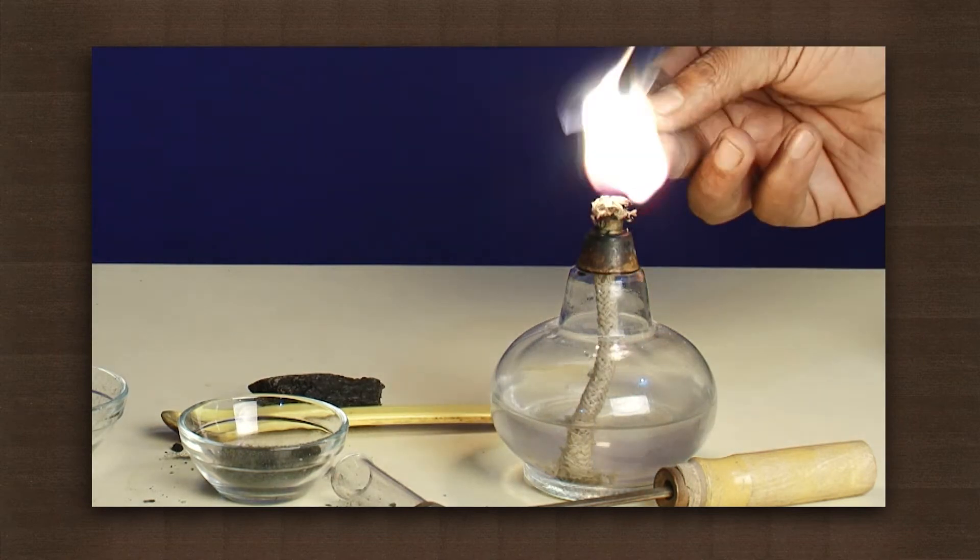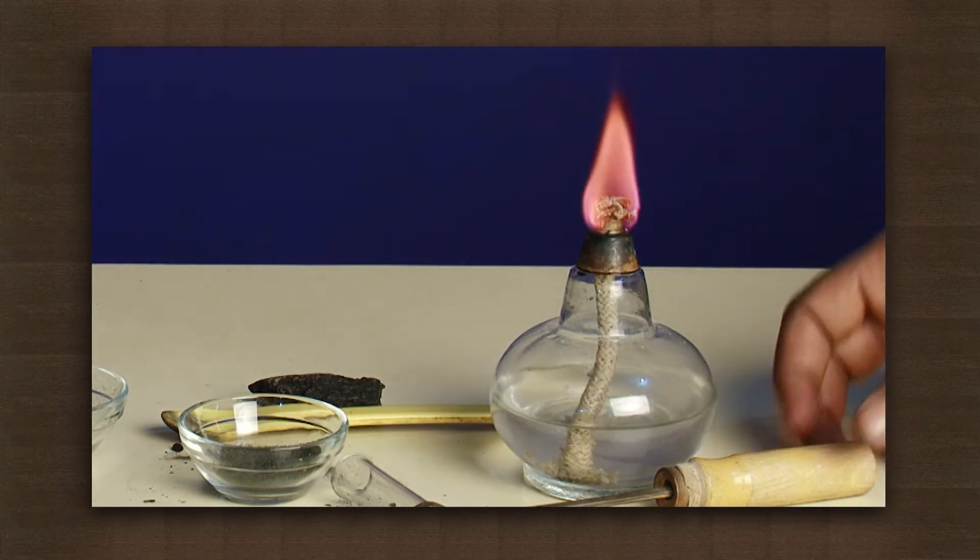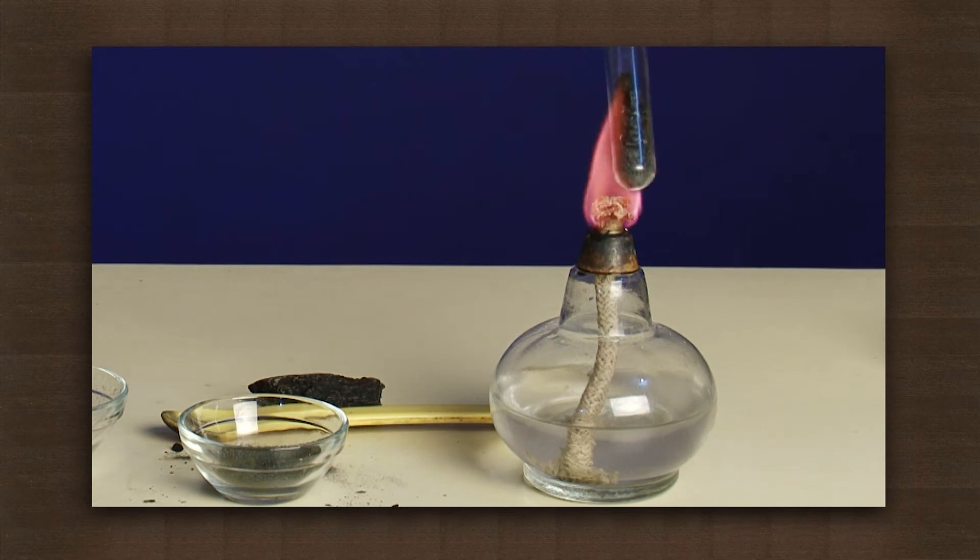Light the spirit lamp. Strongly heat the two layers in the test tube for a few minutes.